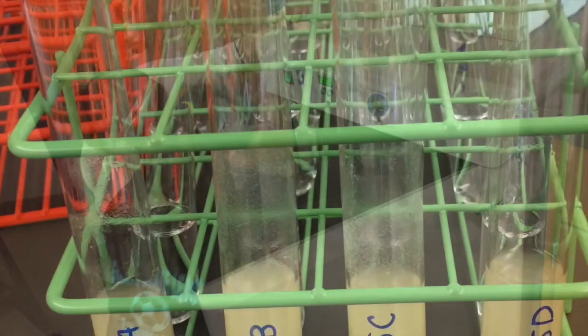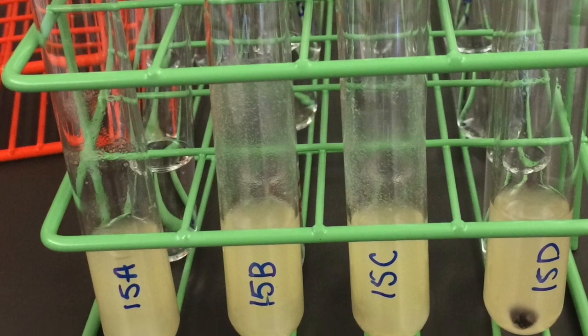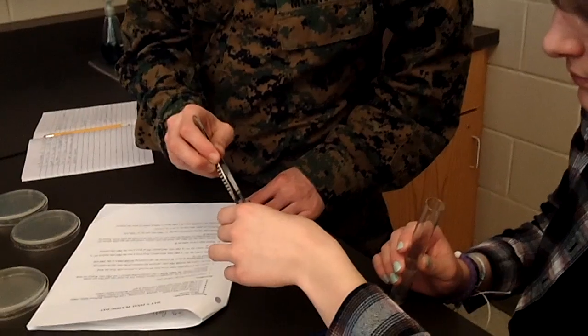Overnight, the millions of cells you just added to your tube will grow to become billions, and then tomorrow you'll take the cells that happen to attach to the plastic beads and move them to a new tube.